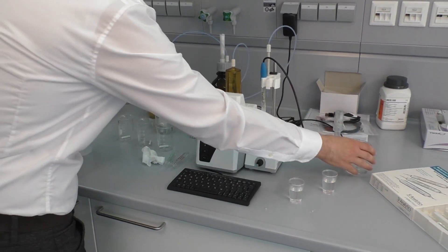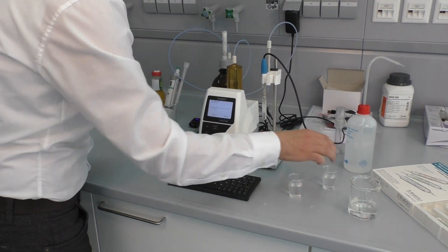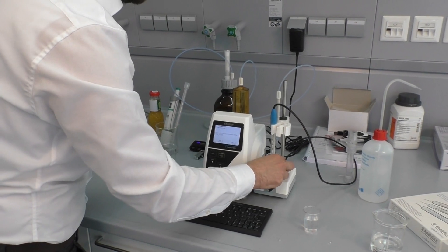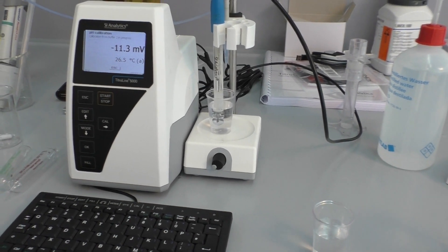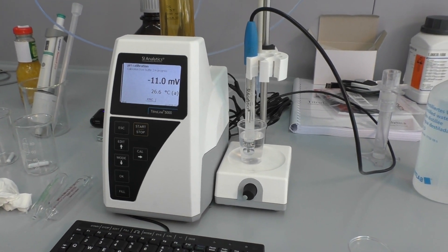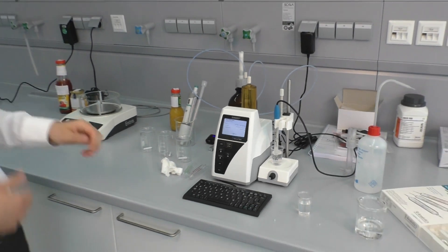Again, the titrator asks for the next step. Again, we are rinsing the electrode, then using the second pH 7 buffer, and then starting the second point calibration with ENTER. When the calibration is ready, the result is shown in the display and the PDF of the calibration result is printed on the USB stick.